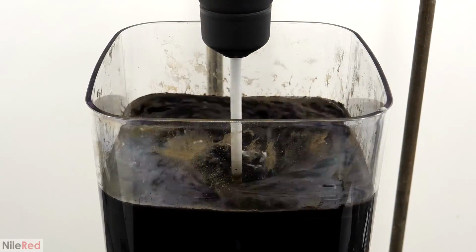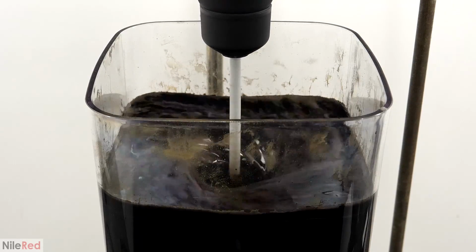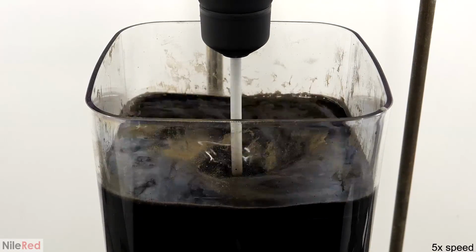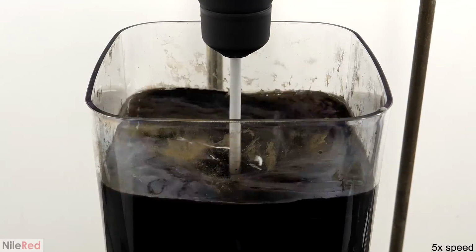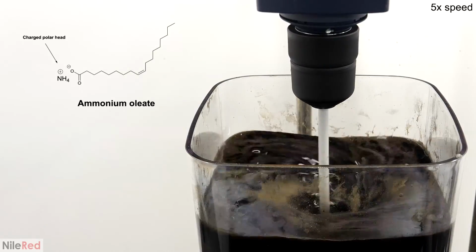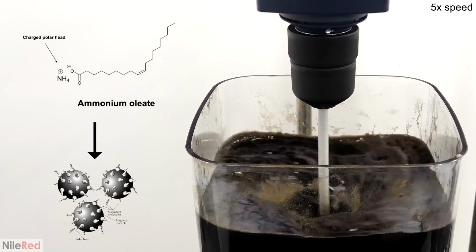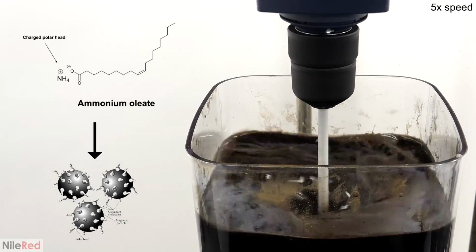I then let it stir over the next 20 minutes or so, and during this time, I slowly increased the RPM up to about 1900. What was happening here was an interaction between the ammonium oleate soap molecules and the magnetite nanoparticles. The charged polar ends of the ammonium oleate were being attracted to the surface of the magnetite. This caused them to adsorb to the surface of them and to stick out their long hydrophobic tails.